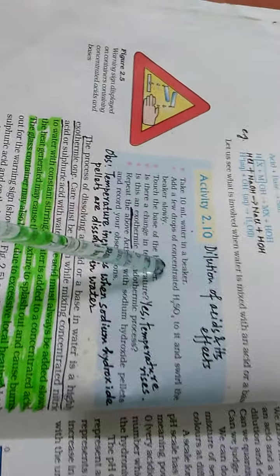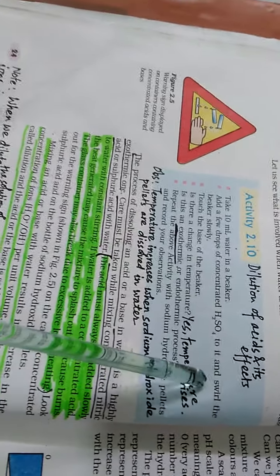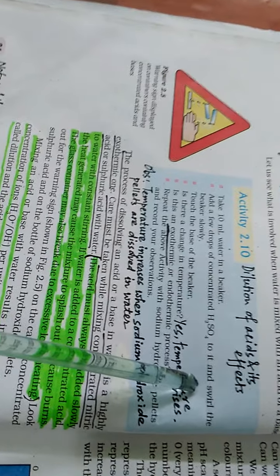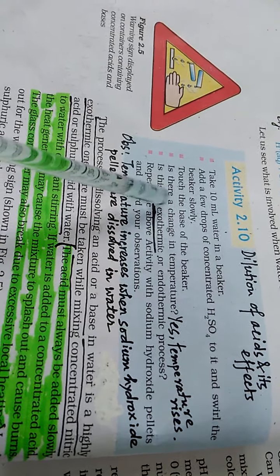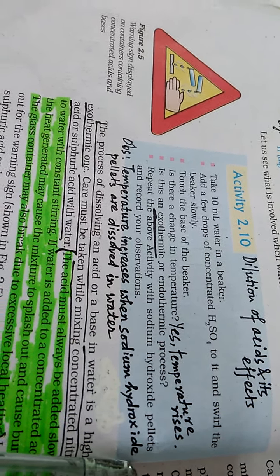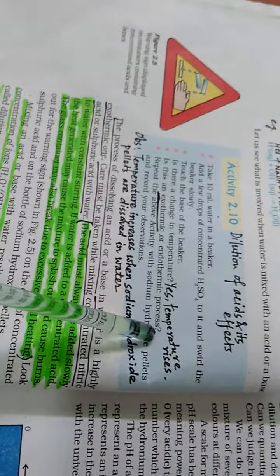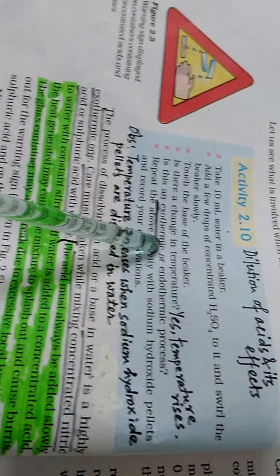We take 10 ml of water in a beaker, add a few drops of concentrated sulfuric acid to it and swirl the beaker slowly. The meaning of the word swirl is to twist or give a fast circular motion to the beaker. Touch the base of the beaker. Is there a change in temperature? Yes, the temperature rises. Is this an exothermic or endothermic process? Yes, this is an exothermic process in which heat is evolved.